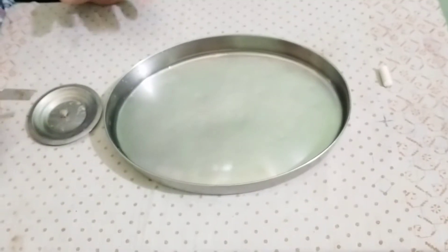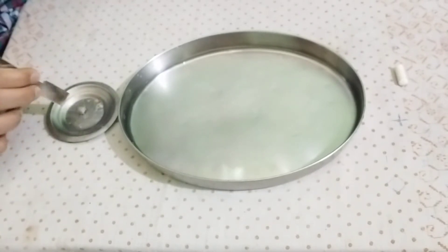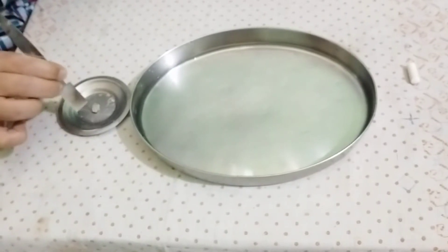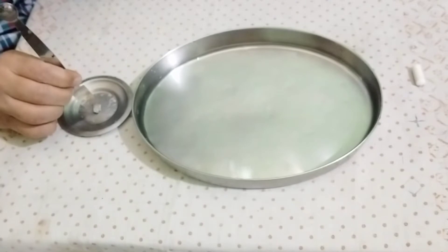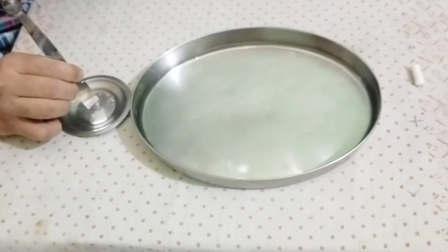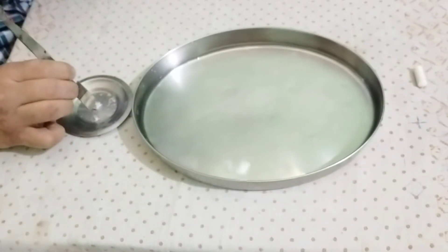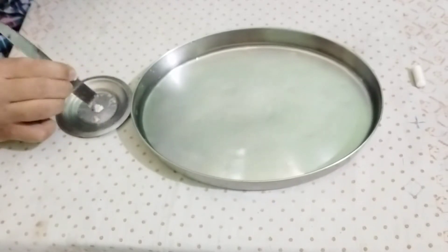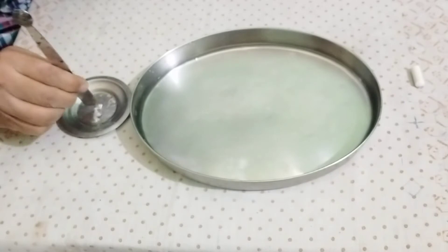In this plate, you can see the sodium metal I have taken. Sodium metal is so soft that you can easily cut it. Just observe very carefully — I am cutting this sodium metal. See, you can easily cut it into pieces. It is so soft.